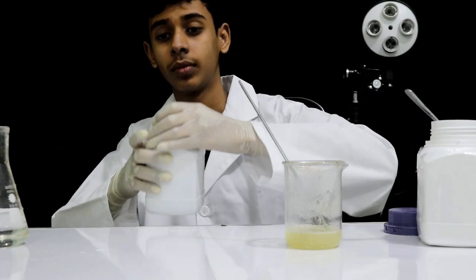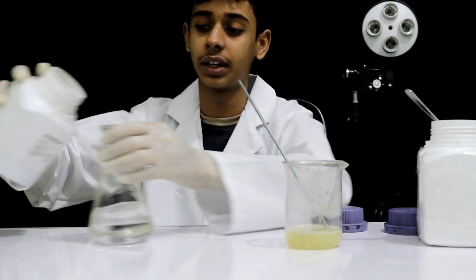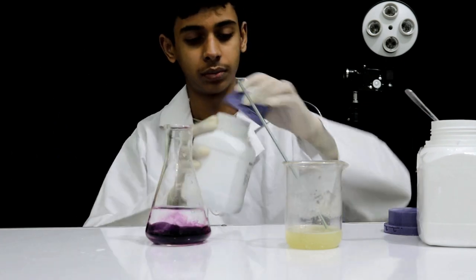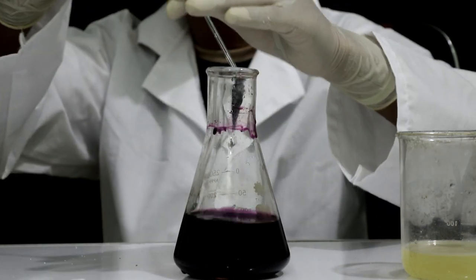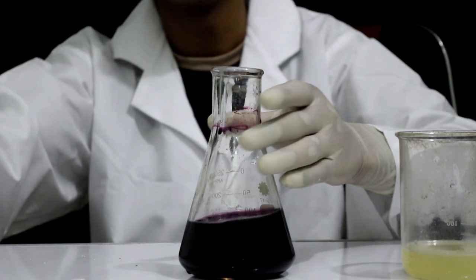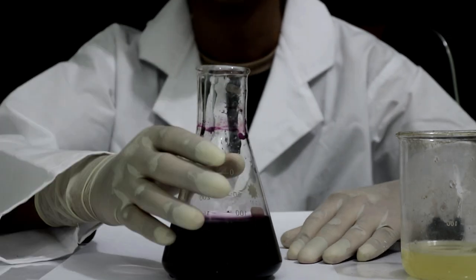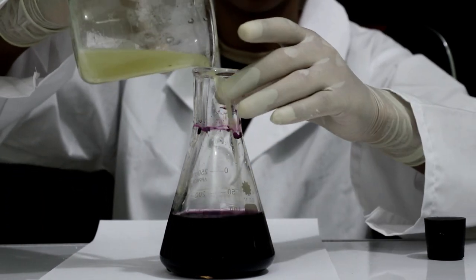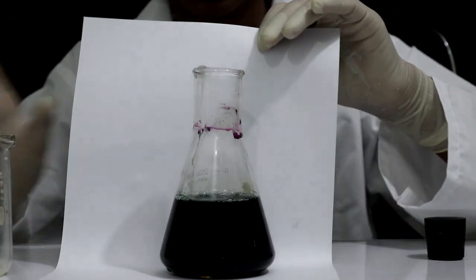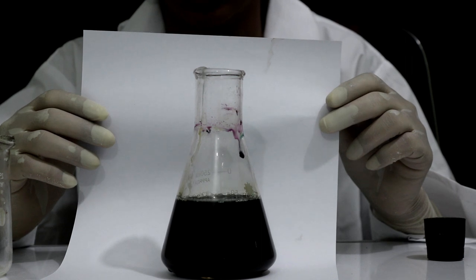We will keep this. This is a little bit less potassium. This is a little bit better. I think I will be able to make the mix. I think it will be a little bit better.